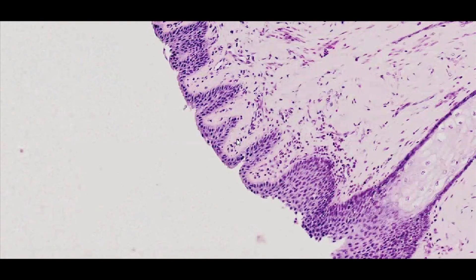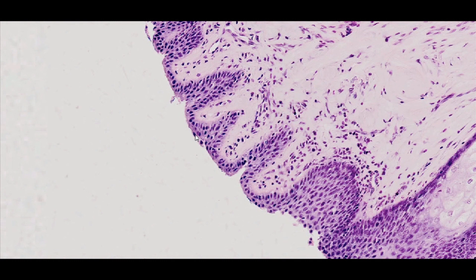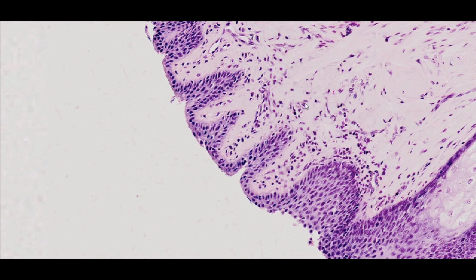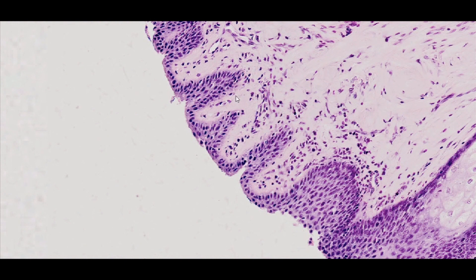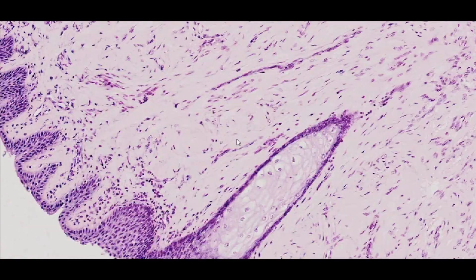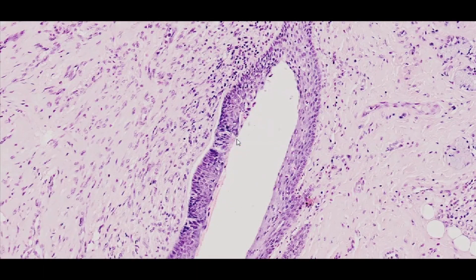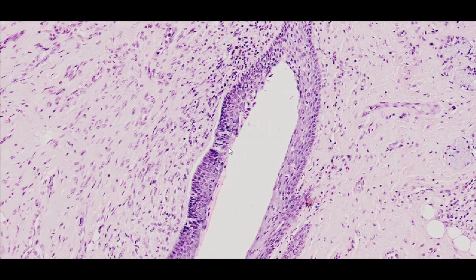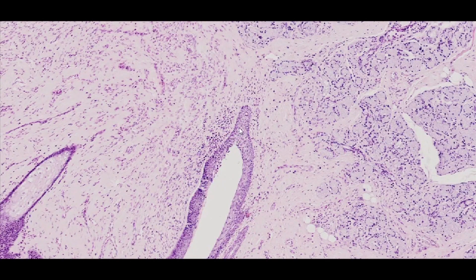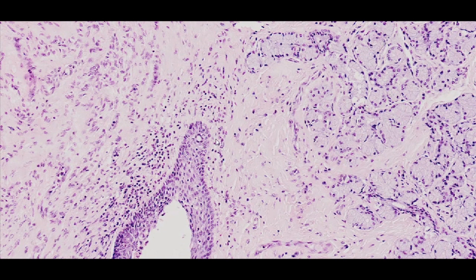The papilla is covered with stratified squamous epithelium, either non-keratinized or slightly keratinized. The connective tissue stroma protrudes into the papillary surface, forming secondary papillae. Brighter barrel-shaped structures referred to as taste buds are visible in the lateral areas of the papilla within the epithelium. They are responsible for the reception of taste stimuli. Furthermore, an opening of the von Ebner serous glands is found at the base of the peripapillary trench.